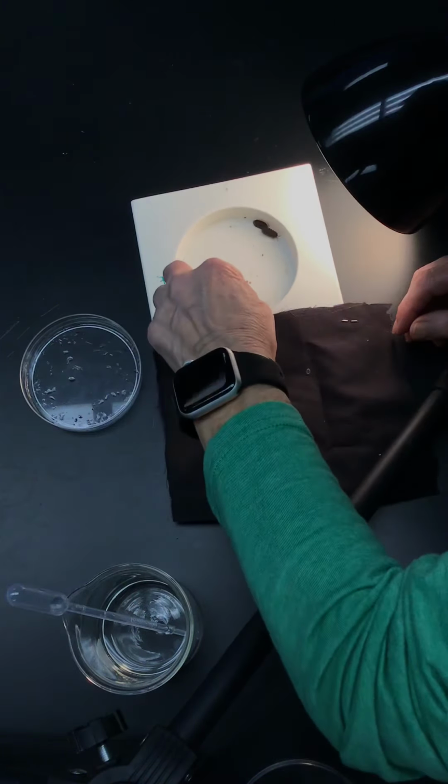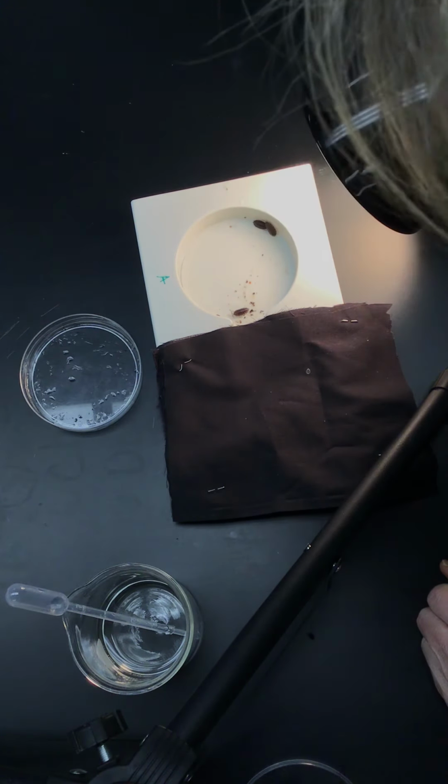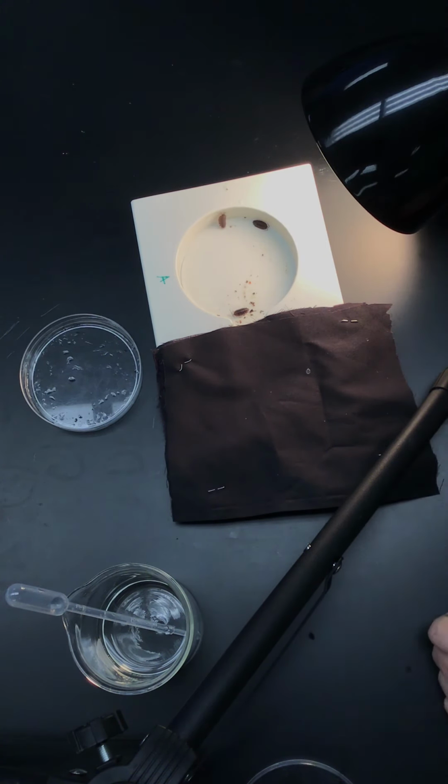So I'll put them over on that side and let's see what they do. Oops, I got one that can't get turned over there. Okay, so this time we've got 4 that are just kind of hanging out here. This is how we wanted it to be from the beginning. I don't know if you can see that very well, but one pill bug is as far up against the edge of the behavior chamber as he can be, I think, to escape as much light as possible. And you can see that they are using their antennae to feel their environment.